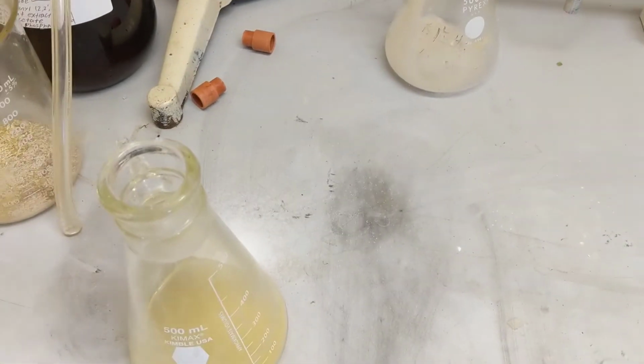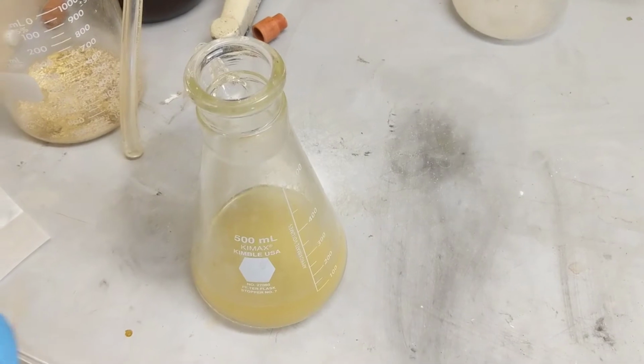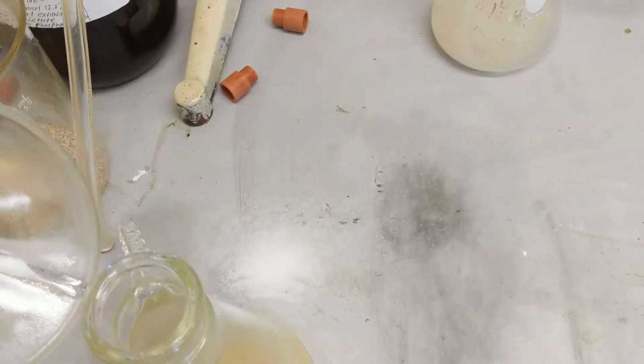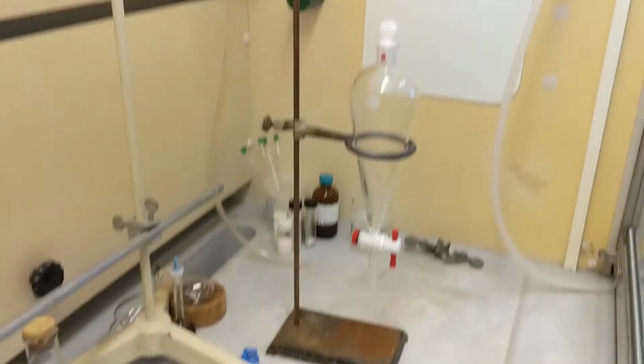You want to add about 20 grams into there, just to make an aqueous layer more clear later. As you can see, I am not Kobe with the shot, but I'll just add some more in there. It just needs to be approximately 20 grams. And then we'll get started on the separation, or the extraction, with the separatory funnel.